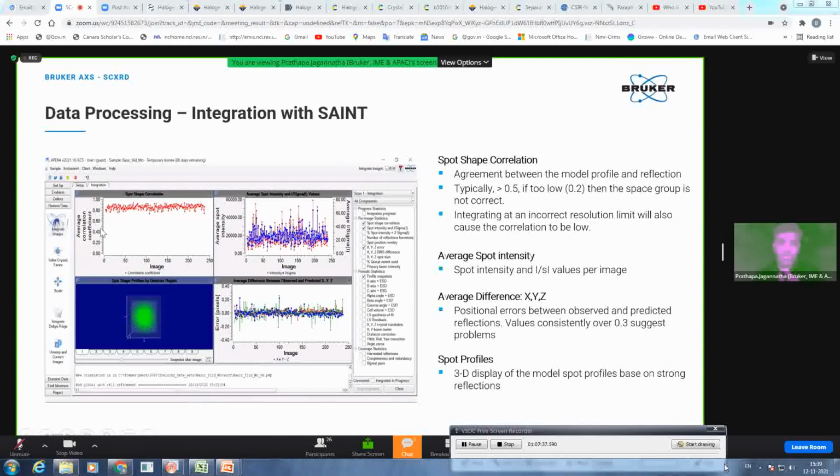If it is between 0.7 and 0.4 or 0.35, then you know it's moderate or weak data. If it is lower than 0.3, then I think you are integrating in the wrong space group, or the data can be really poor. Okay. The second graph explains the average intensity versus I sigma versus the images.